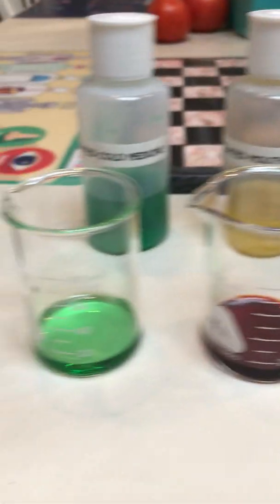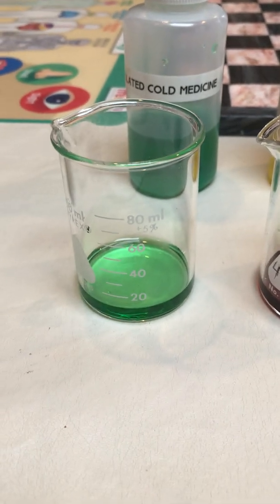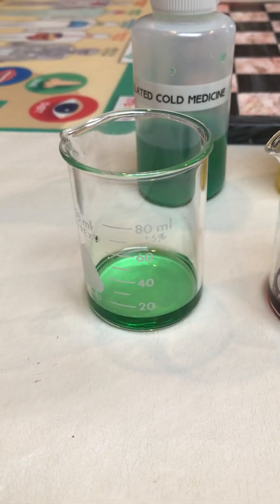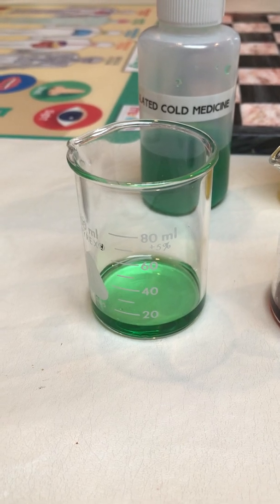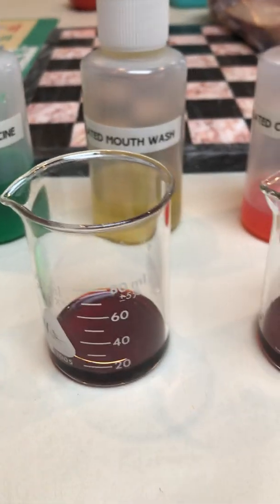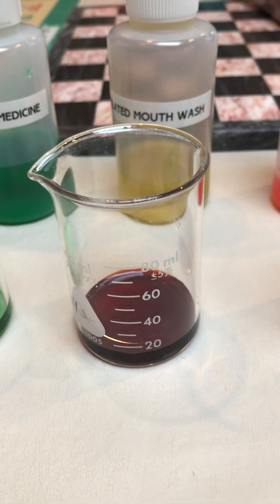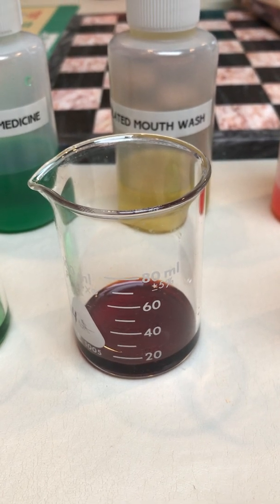And what do we see? Green! Cold medicine started out as a bright green and it's still bright green. All right. We see our mouthwash, which has started out as yellow, has turned dark red!